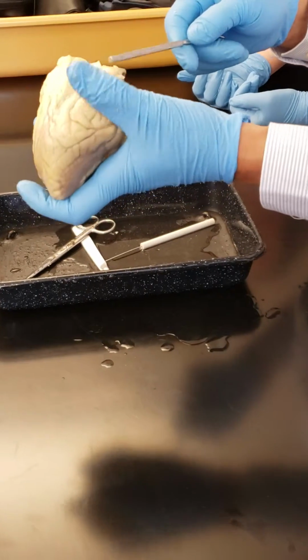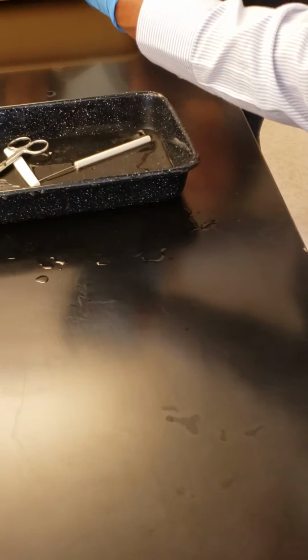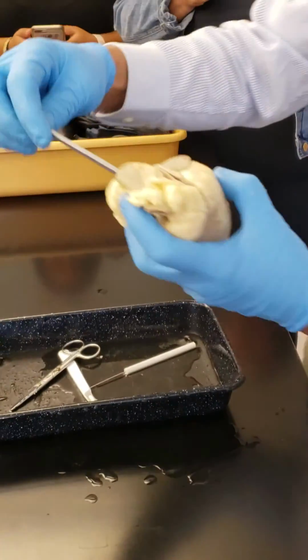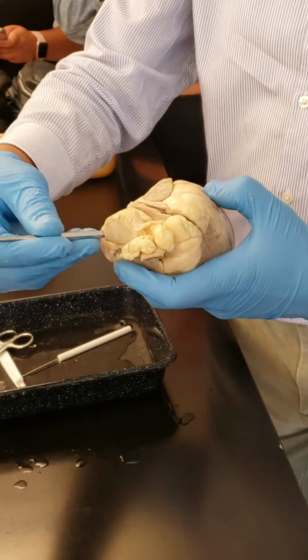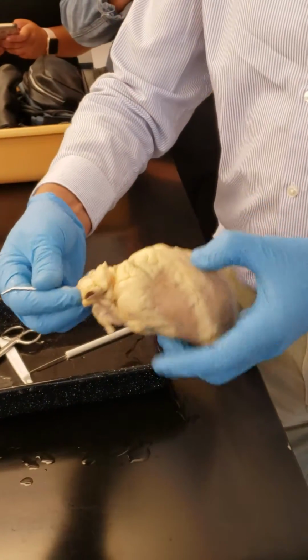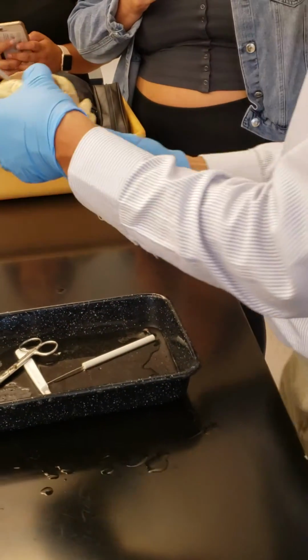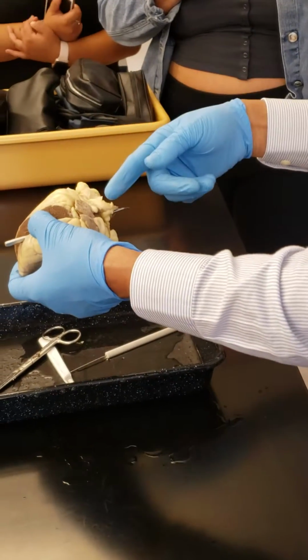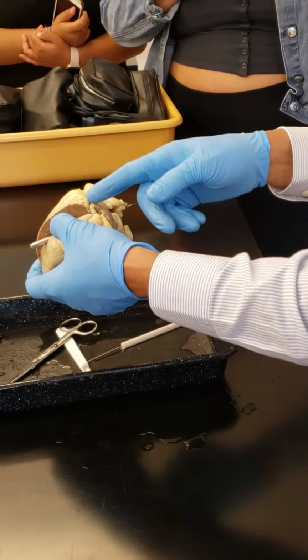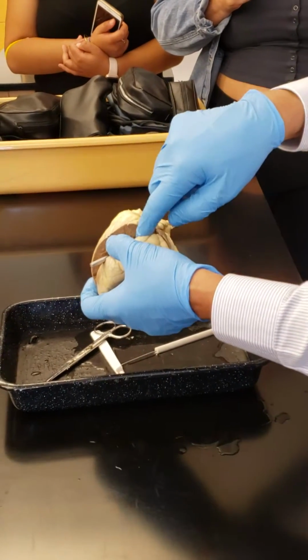And the last one, I need to borrow this thing here. The last one is at the base of the aorta. And again, do you know that this is the pulmonary trunk? And I told you that this is the aorta here, right? So what I do is I go like this, and see it comes into the ventricle. Because this aorta comes from the ventricle, right? And wherever this aorta starts, near the ventricle, right there, just like these three, there are those three.